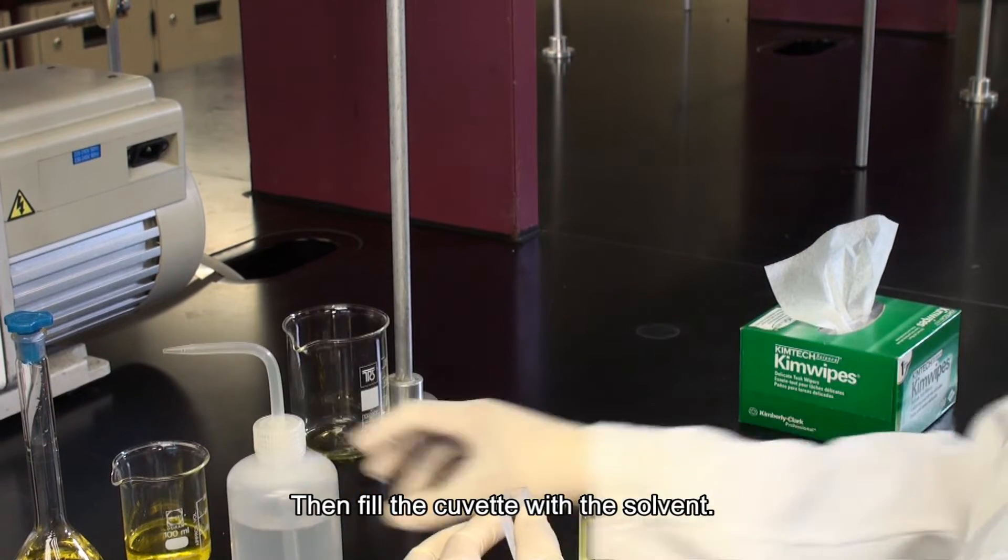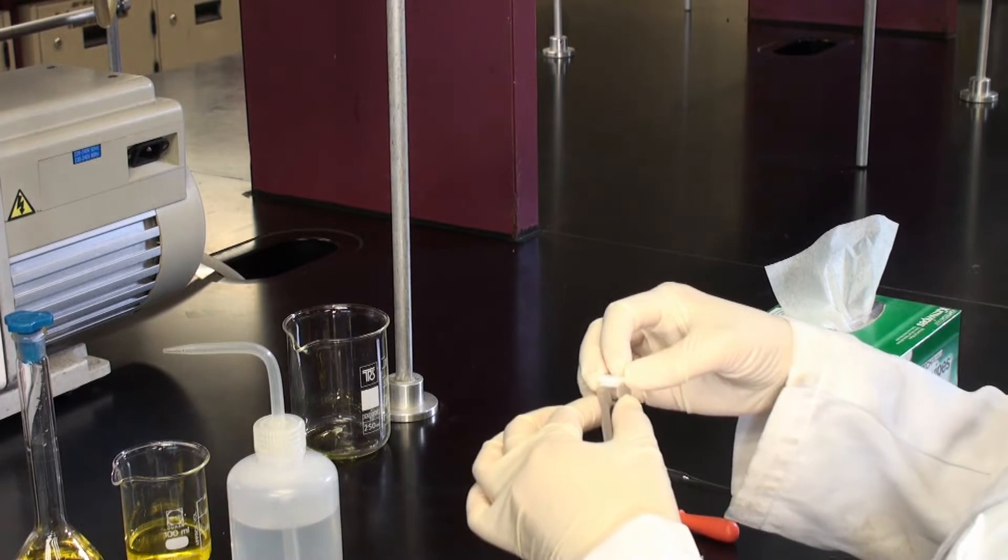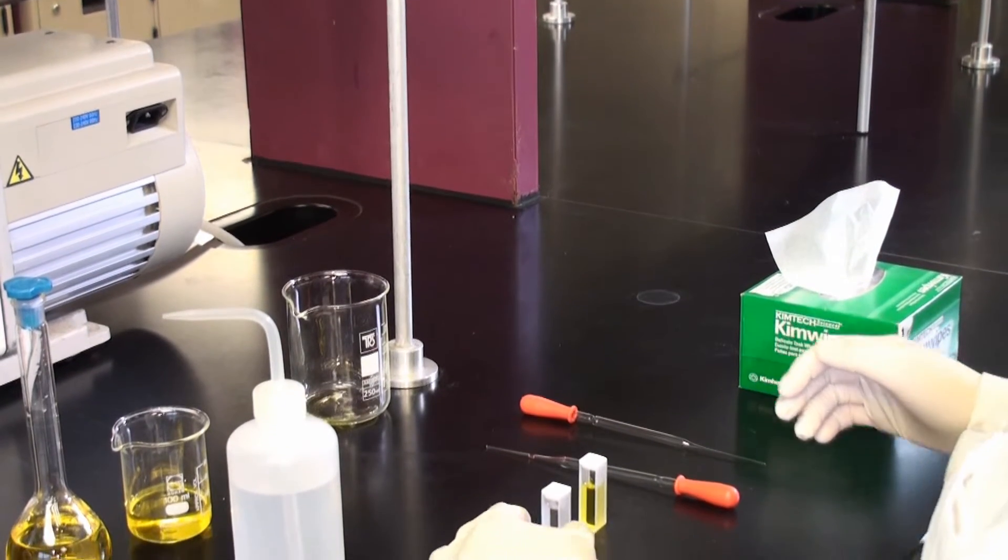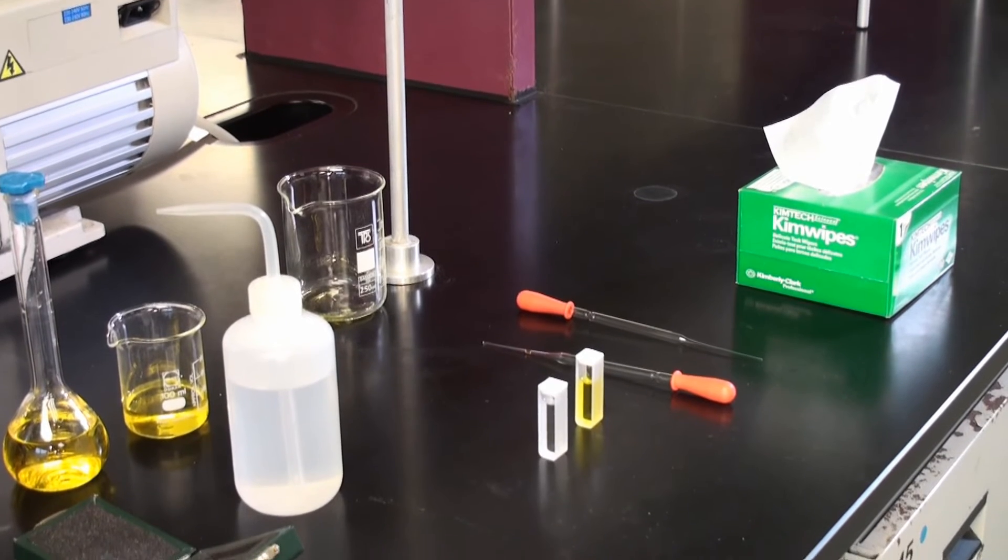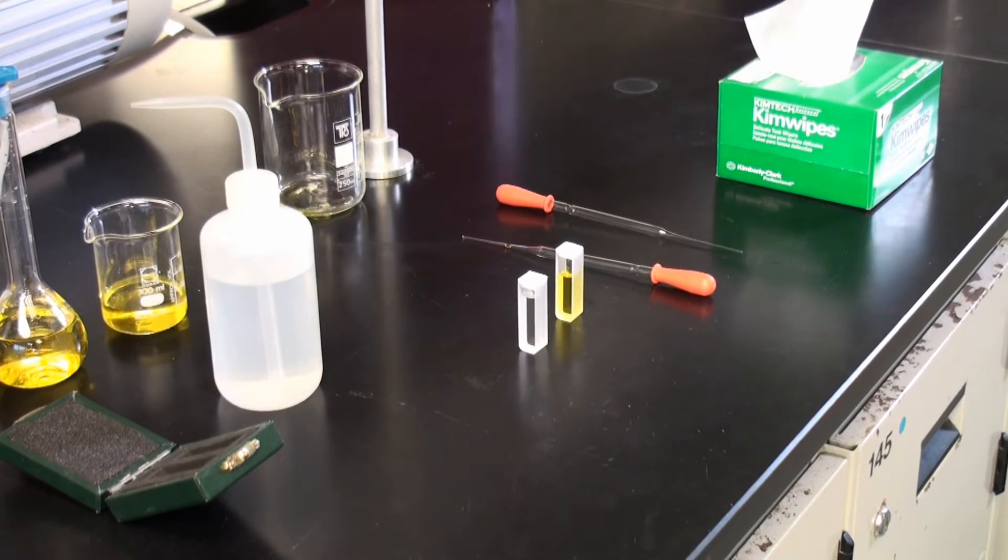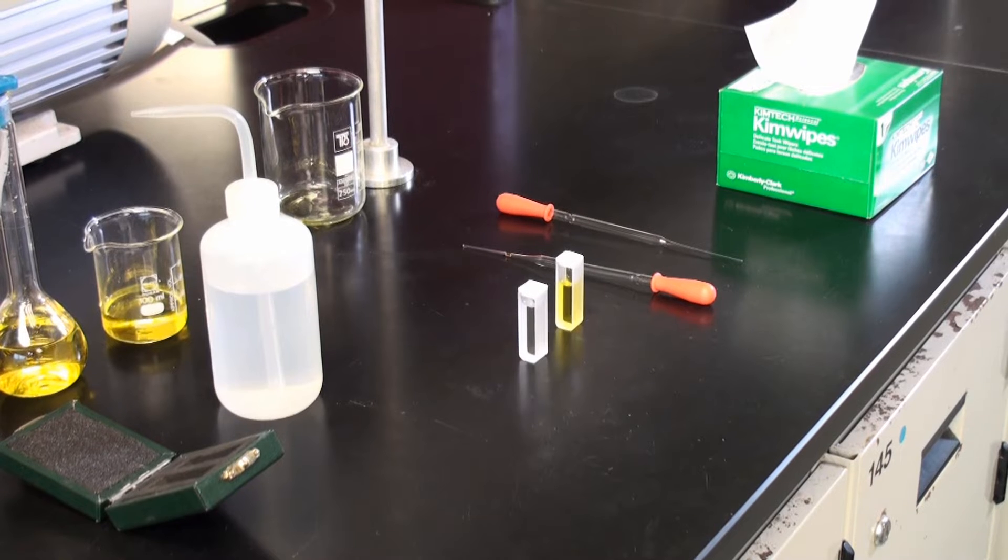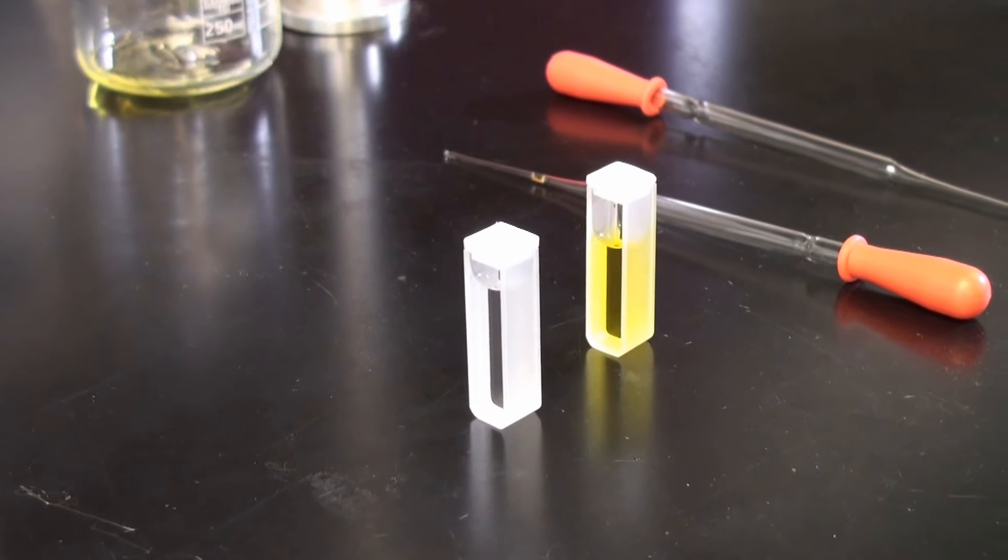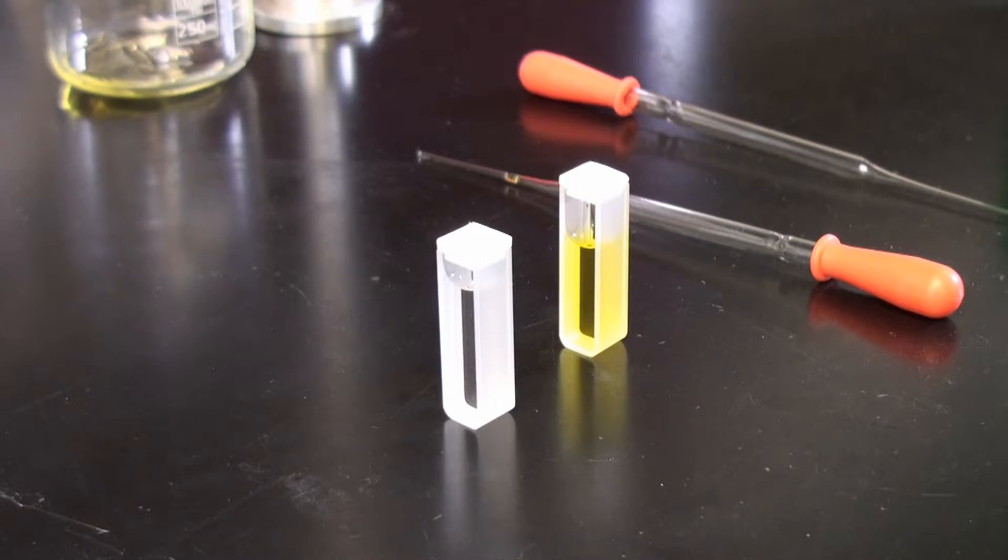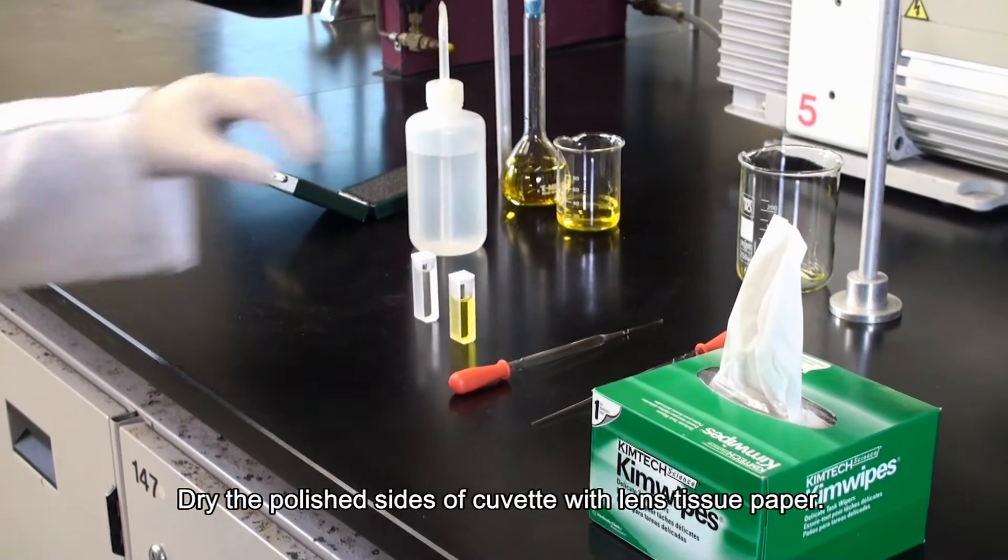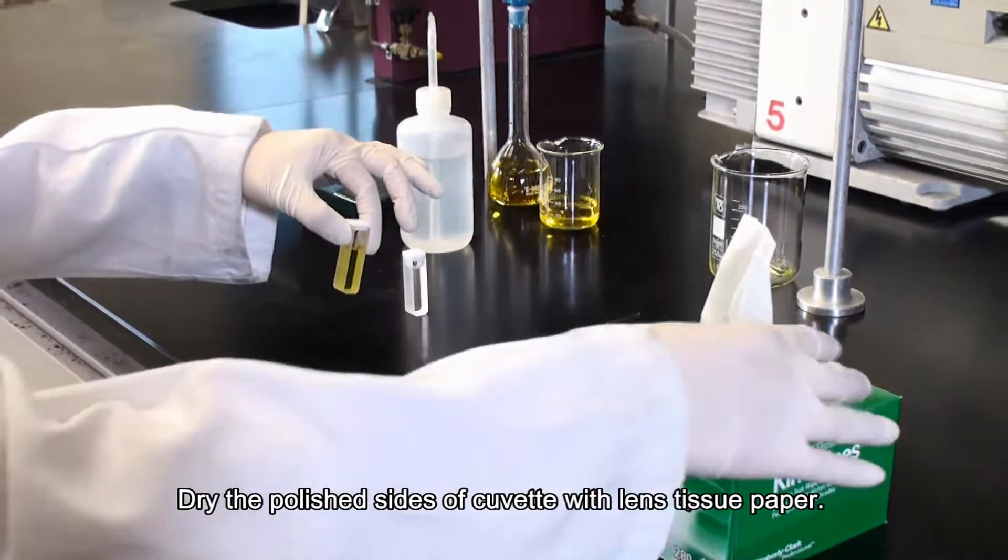Then fill the cuvette with the solvent. Cover the cuvette. Dry the polished side of cuvette with lens tissue paper.